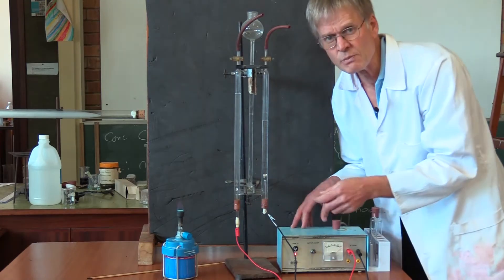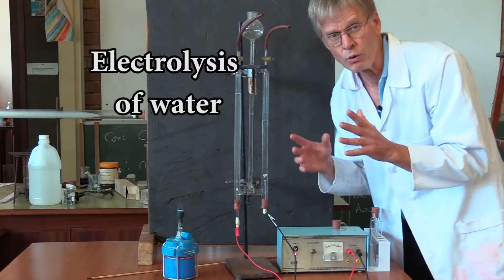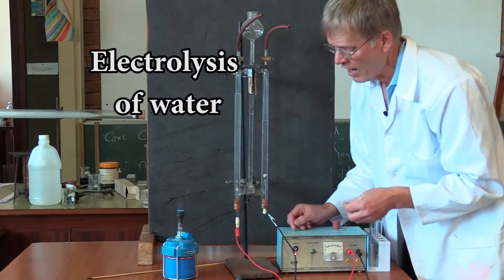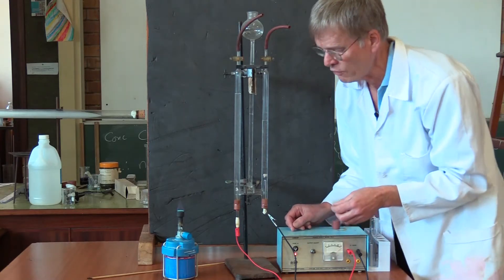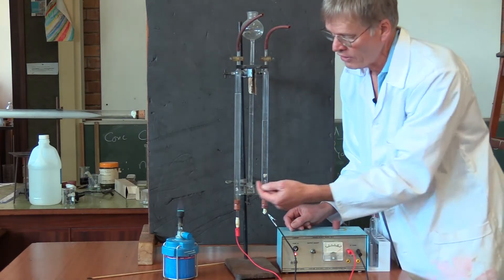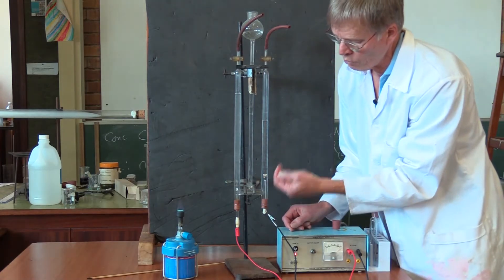And the electricity splits the water molecule up. We call that electrolysis, the splitting up of water. Electrolysis is the term we use for a chemical reaction induced by electricity. So the electrolysis of water is occurring.